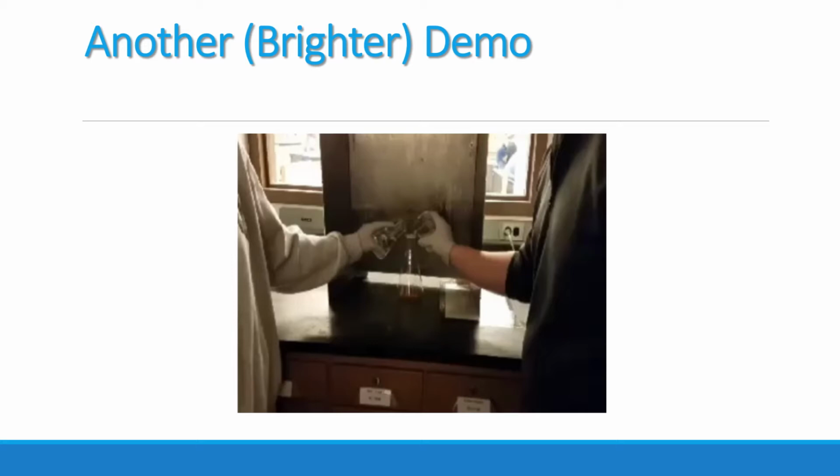As our own demonstration produced a glow that was difficult to see on camera, we have provided another video of the luminol reaction that was performed here at Purdue University. In this lab, luminol was synthesized using the same reaction scheme previously discussed.